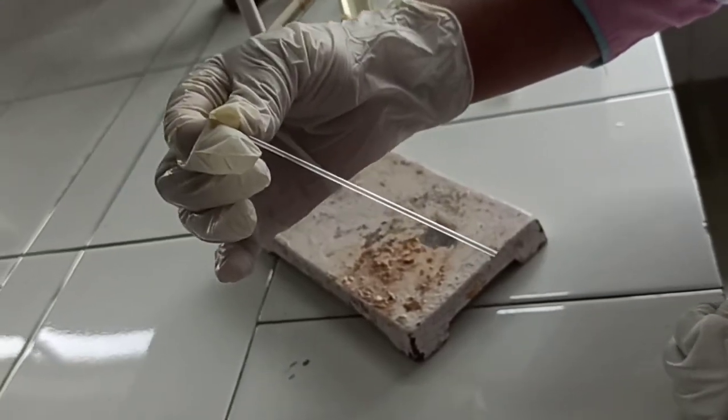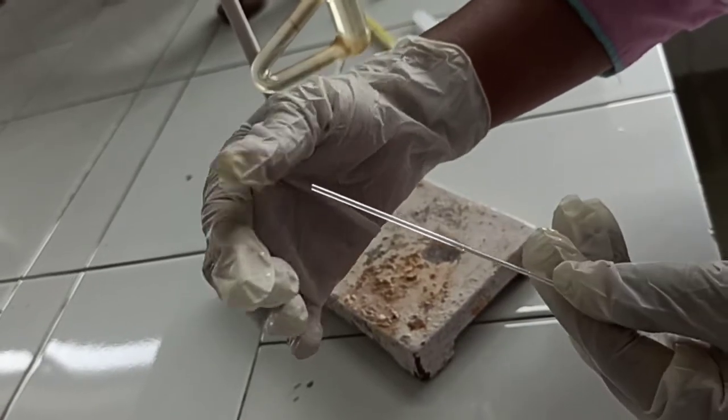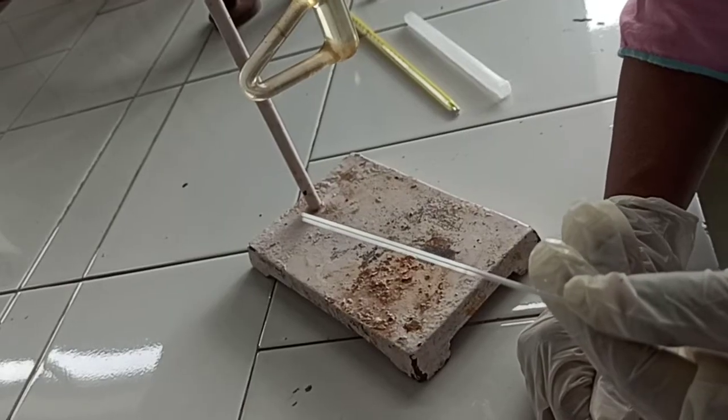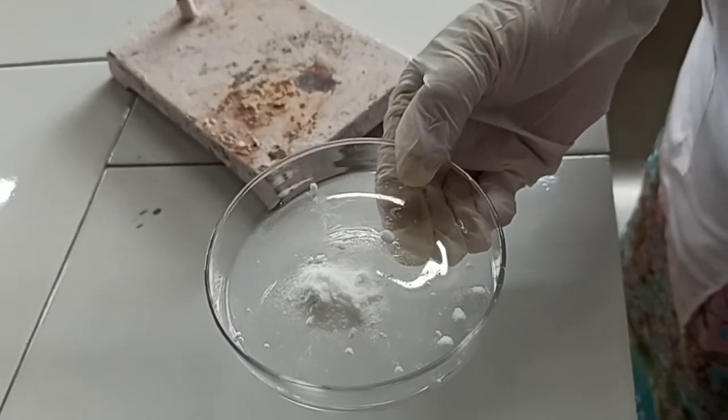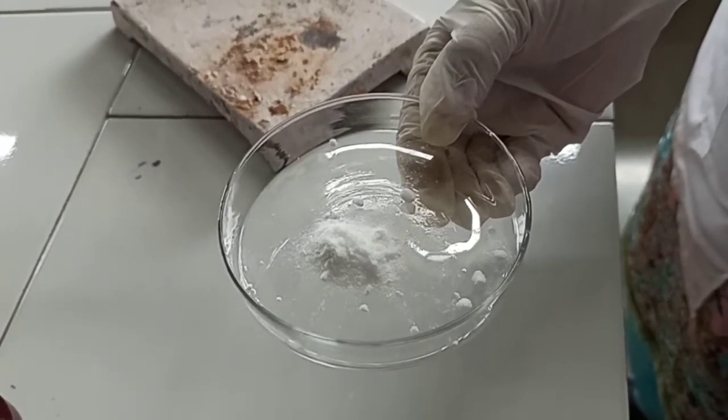This is capillary tube. We have to fill the solid substance in this capillary tube for determination of melting point. This is our unknown sample of which we have to determine their melting point.